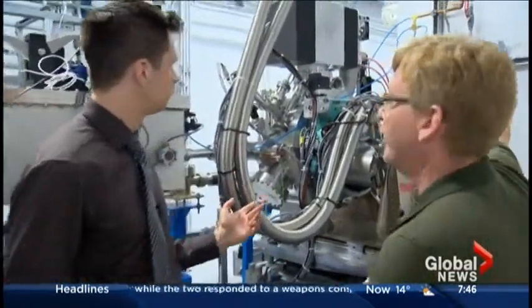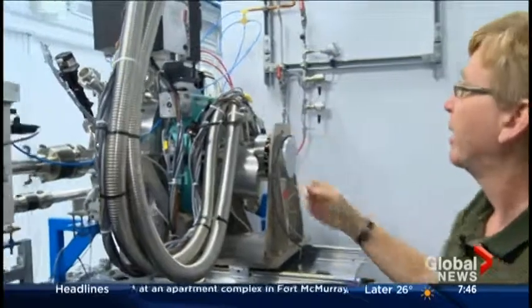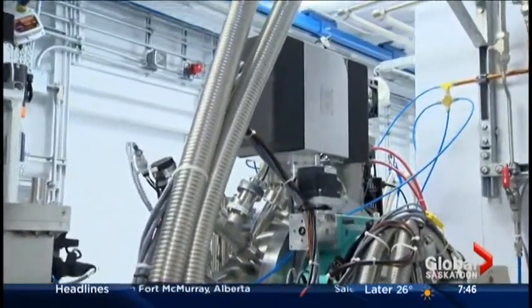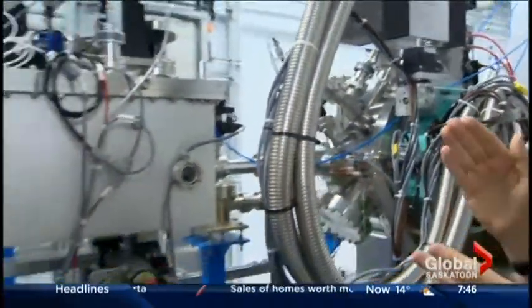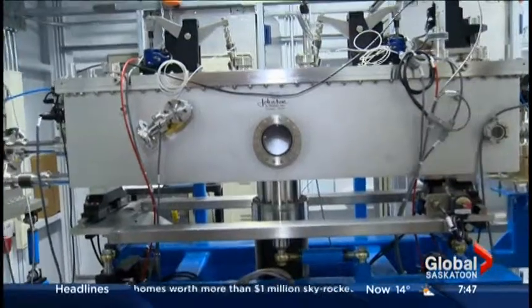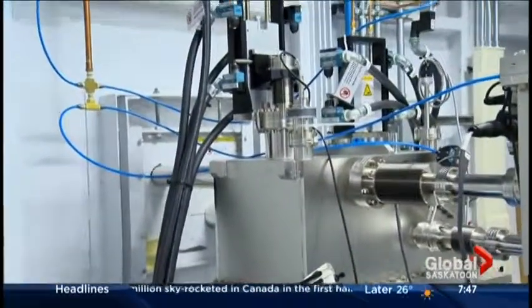So what are some of the basics? Well, light is being generated by our accelerator and it's passing down a tube here. These components you see here — this is called a monochromator. The monochromator's role is to choose the particular energy of the light that we want to use. This is a mirror tank; it focuses the beam down to a really small spot size. And then the component here filters out some of the energy of the beam, and then it'll pass on to where we actually do the experiments.